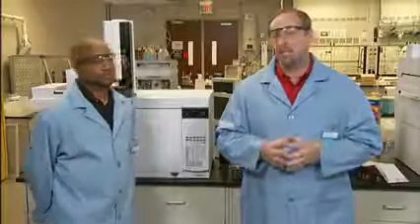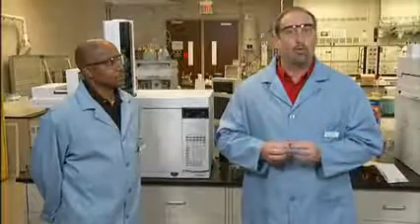If you're going faster or slower with the flow and changing temperature at the same time, then the compounds you're chromatographing are going to be experiencing different temperatures. This will definitely affect retention time and could even switch retention order. And nobody wants that. If that happens, we won't know what's coming out when. Make sure you check all the flow and temperature settings against your method documentation to make sure you don't have any errant settings. Starting temperatures, hold times, ramp rates, as well as flow rates can prove to be critical, especially if you have closely eluting peaks or a complex mixture for a sample.